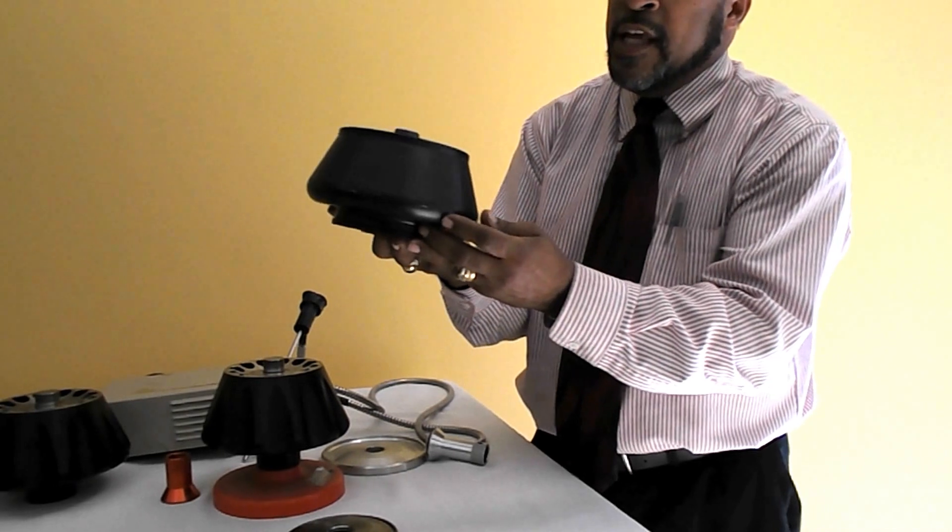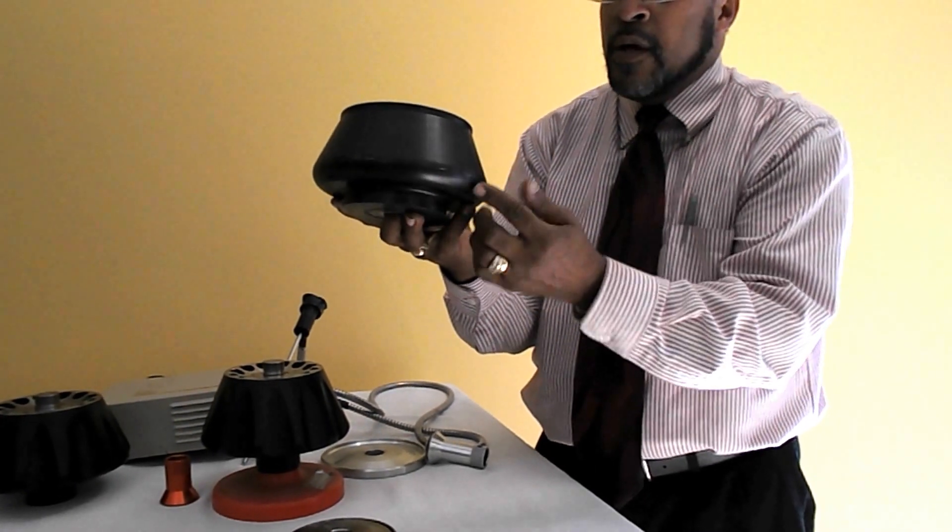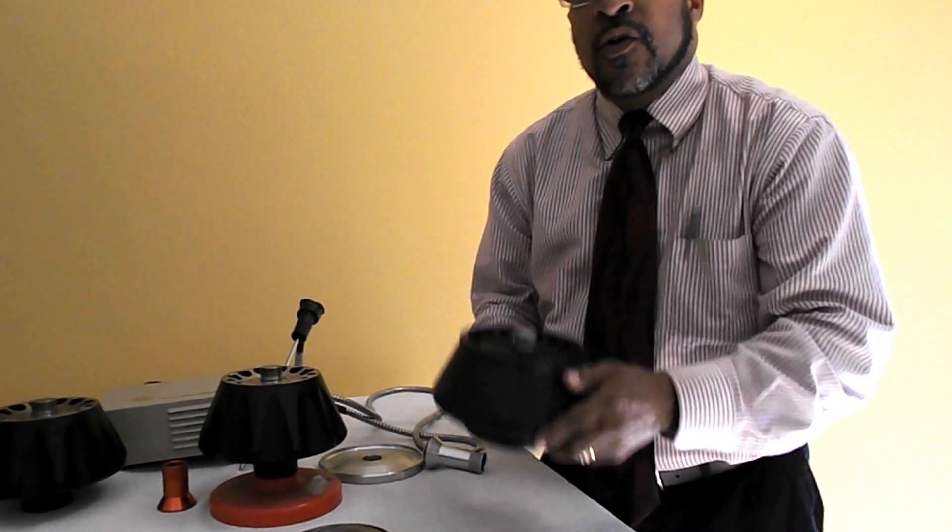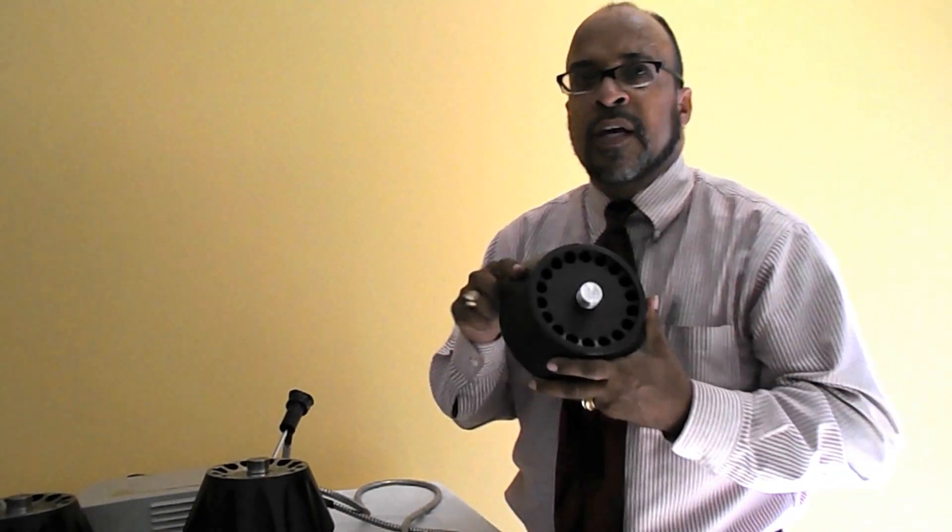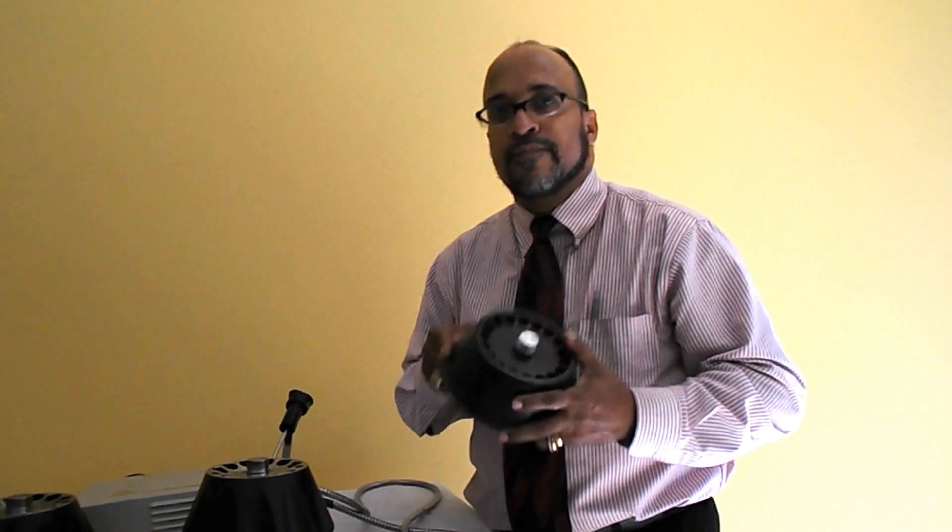But you really need to be careful of R-Max which is actually at the bottom of the cavity and will be approximately right here. So your tube will go in here. R-Max is about right here. You get a lot of sediment that will settle there. That definitely needs to be cleaned. Corrosion will take place in an aluminum based rotor. So these need to be cleaned a lot when used.